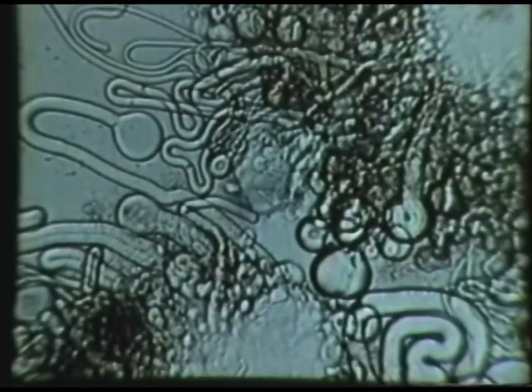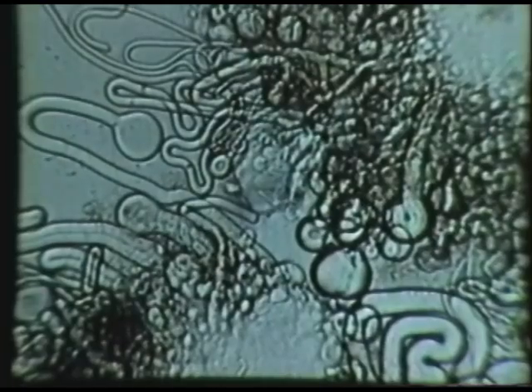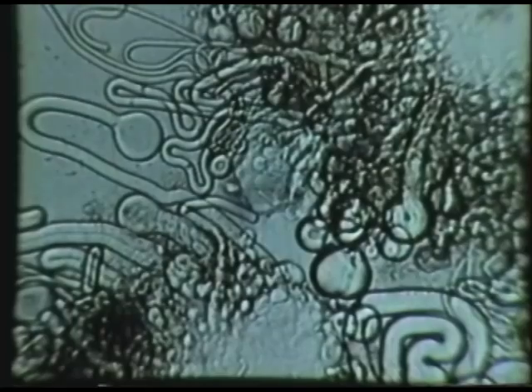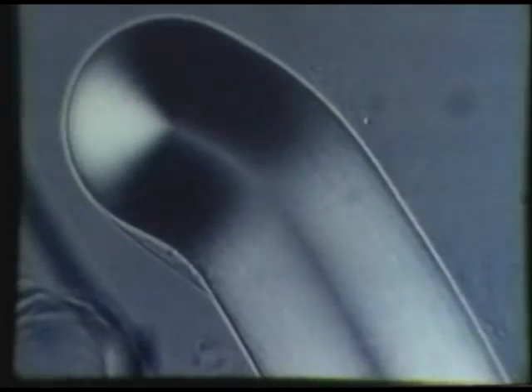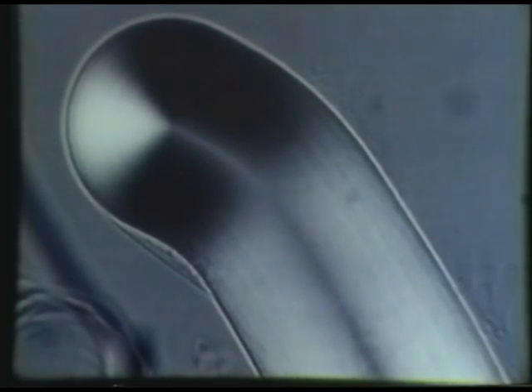Myelin figures are composed of concentric arrangements of lipid bilayers separated by water spaces. When the lipid bilayers are tightly packed, they have a periodicity of 40 angstroms, and they appear under the phase contrast microscope as rigid, thick-walled structures.